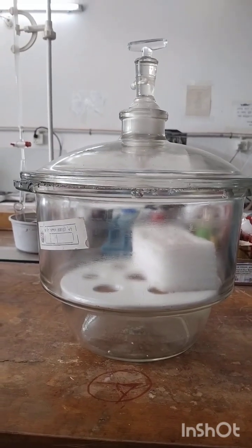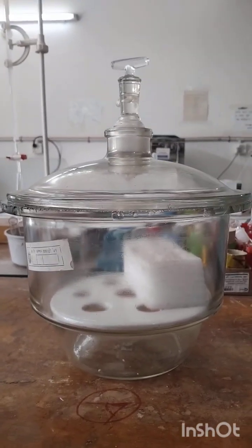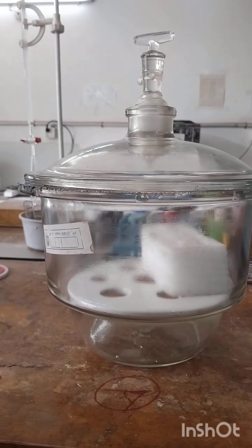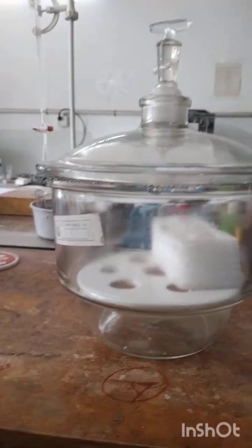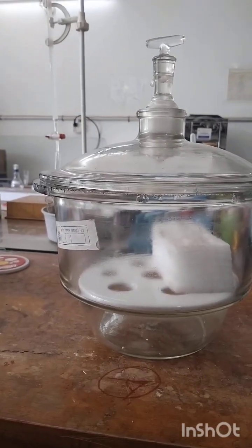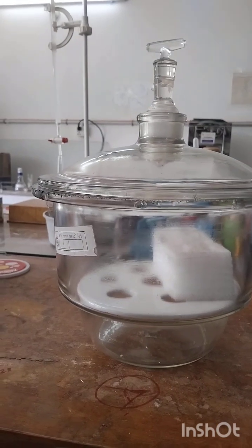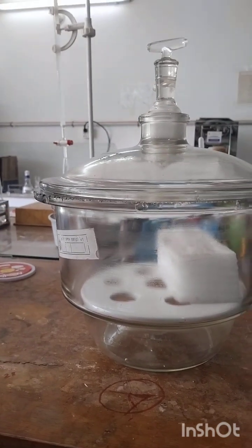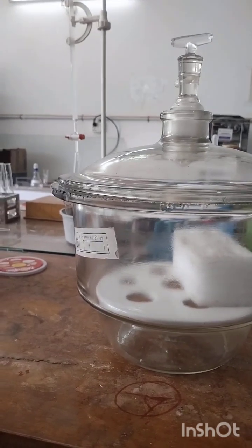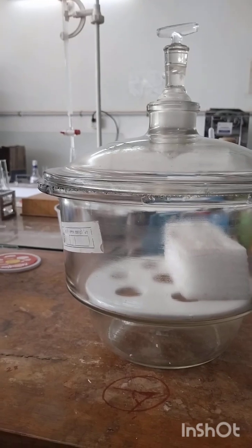At first, we have to keep in mind how to define this term desiccator, and by using what kind of materials we are able to keep our samples or products moisture free. So I'd like to give you some theoretical knowledge. How can you define this term desiccator? A desiccator is a sealed container used to keep substances dry or to cool substances in a moisture-free environment, commonly used in chemistry labs for storing hygroscopic chemicals or drying samples.